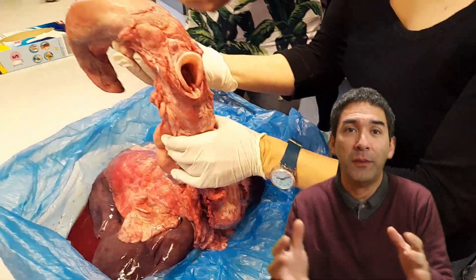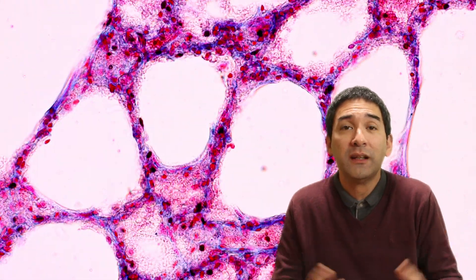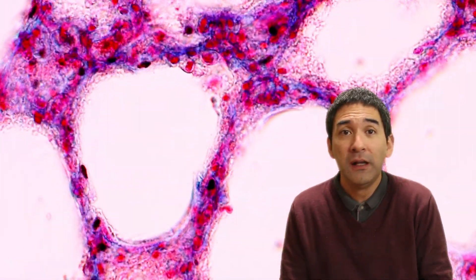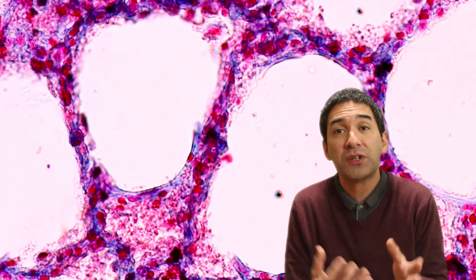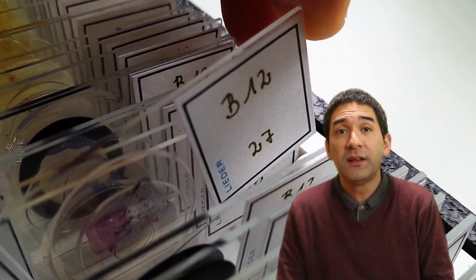At the end of the video I'll be returning to the dissection of the pig's lungs and give you a little background story of how we got the organs. But for now, let's do some microscopy first. I'll show you how healthy lungs look under the microscope, and then show what happens to a person suffering from COPD, a disease you might get from smoking.